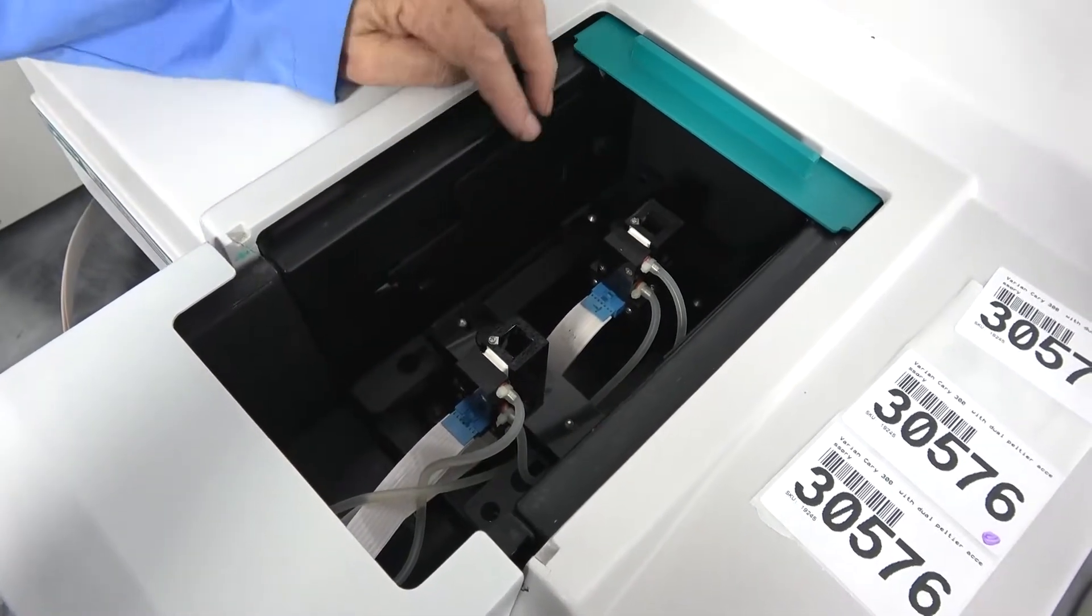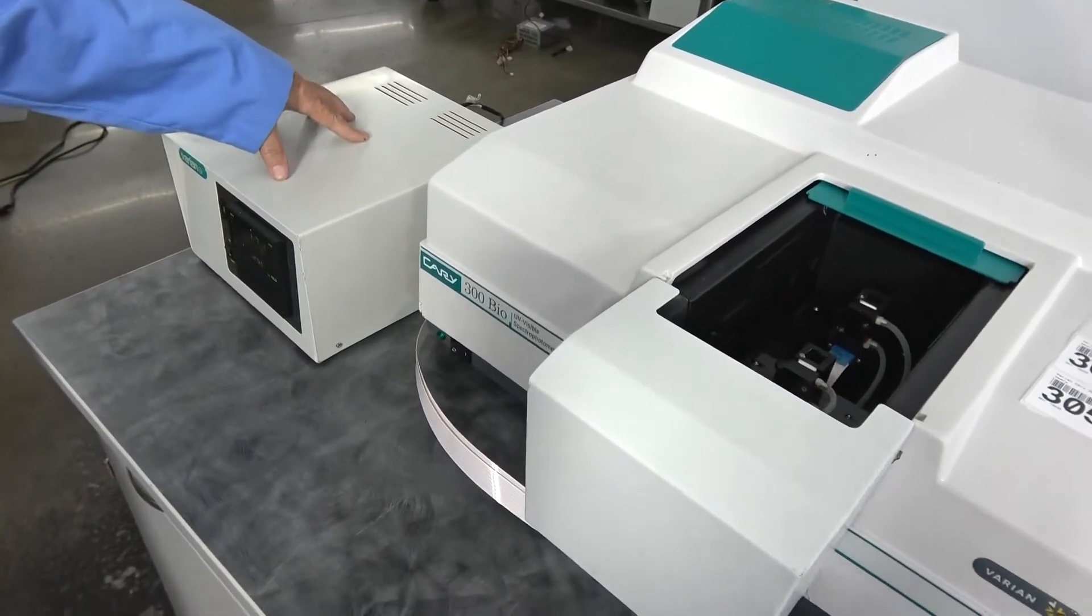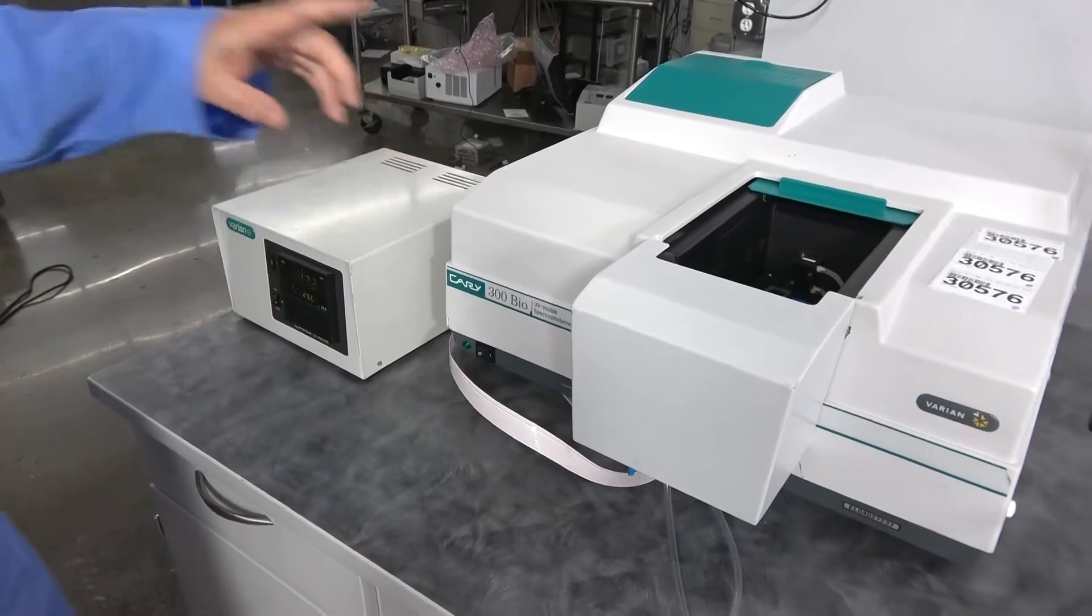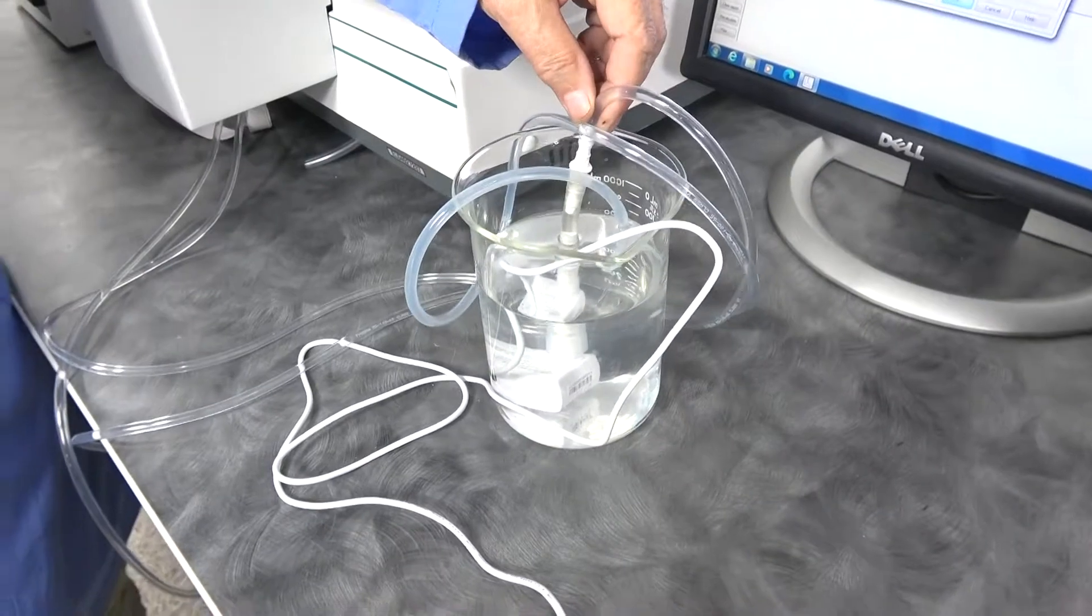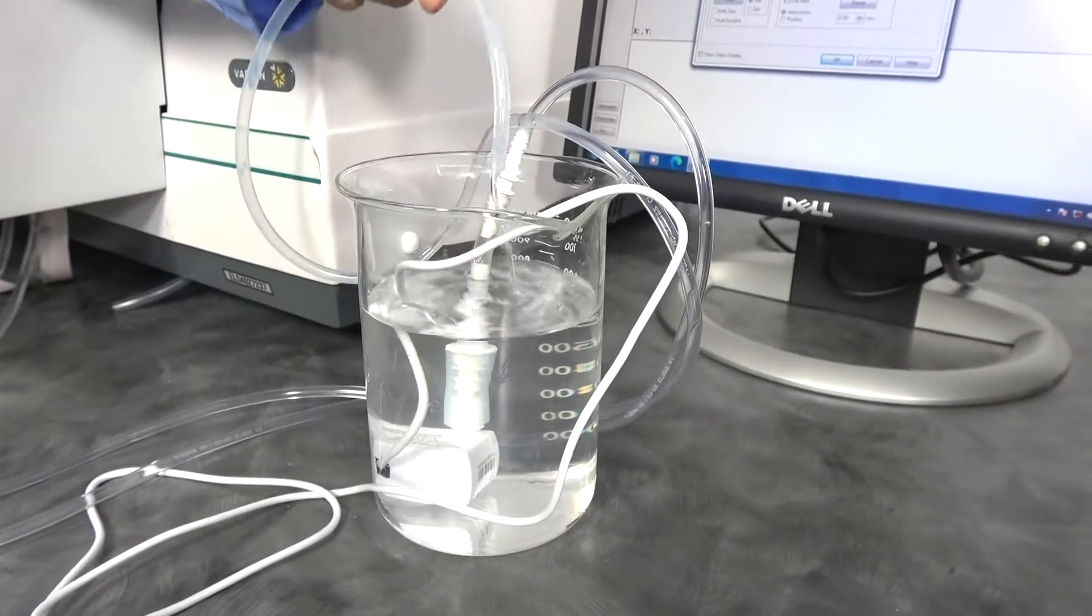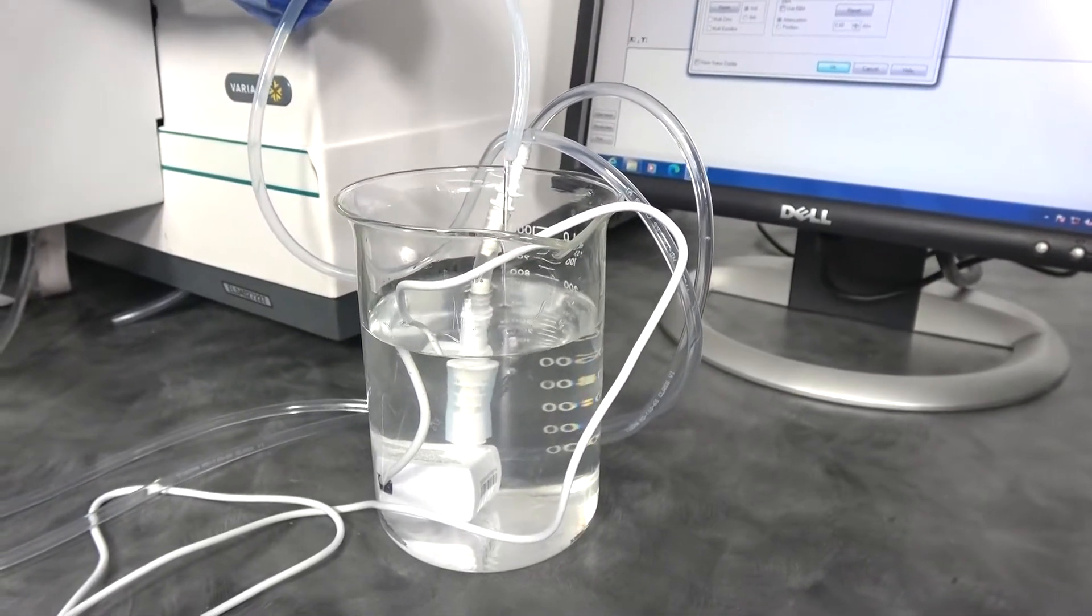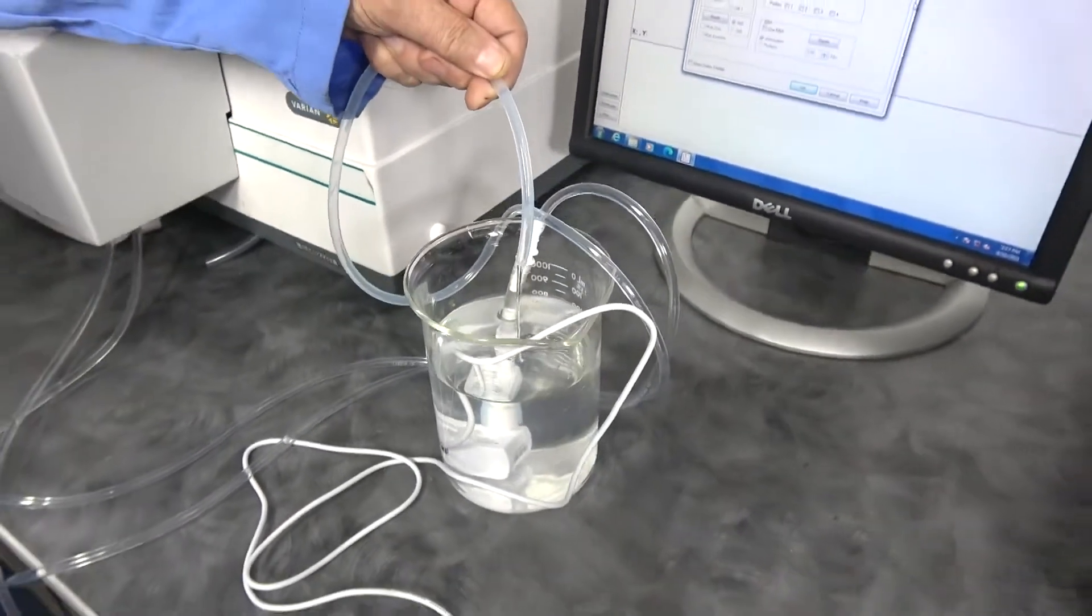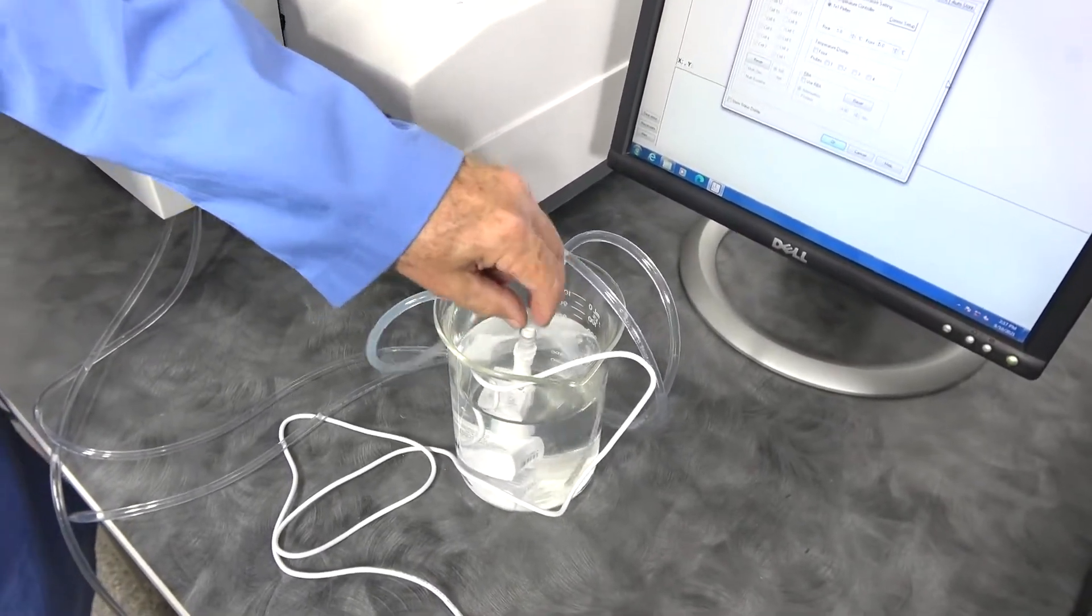The water on this type of unit doesn't come from the temperature controller as they do in the 6x6 and 8x8 transports, but by some type of water hose. One of the options they offer is with just a submersible pump. It doesn't take much water flow to cool them. This was an optional pump, and your other option was to put it just to a water tap. A small flow will be more than enough to get your temperature down.